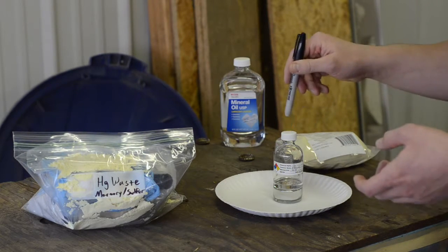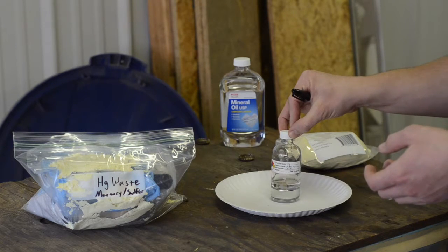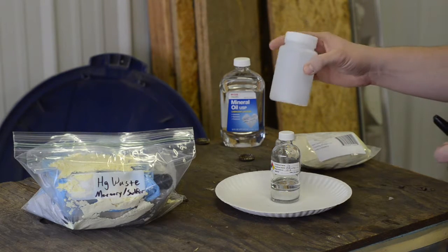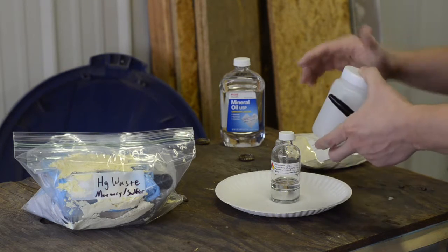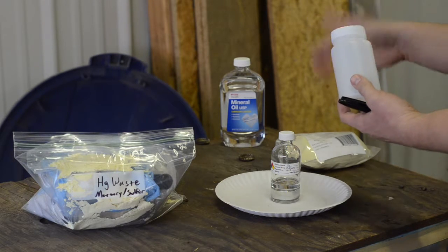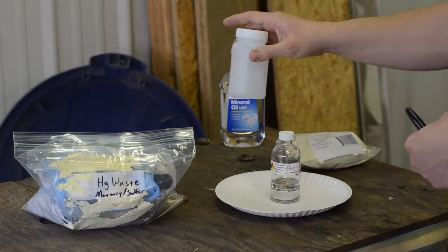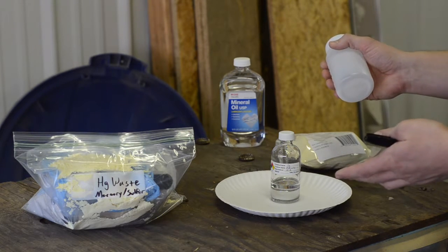The real danger with this now is if this borosilicate bottle were to break. I have one of these on the way. That's a plastic chemical storage container that is big enough to hold this inside of it. And so I'll take one of these and pad it with cotton balls and then pour more sulfur on top of it, because why not? And then this will sit inside of that, and then the whole thing will go into the hazmat cabinet. So that's the final plan.